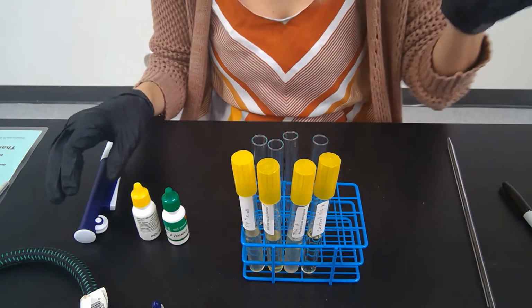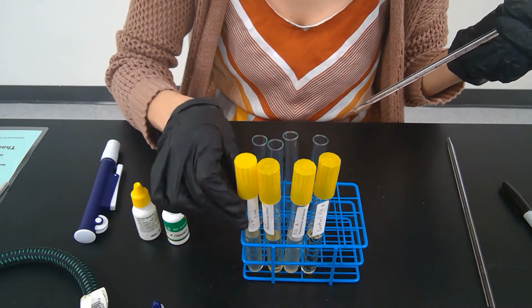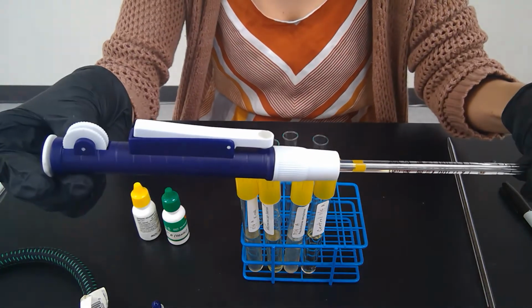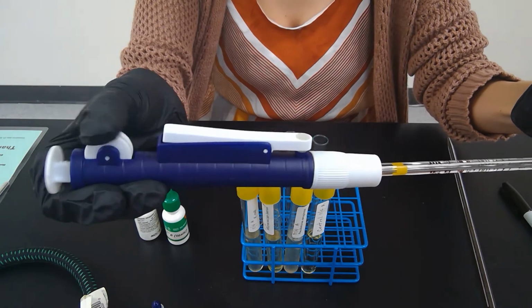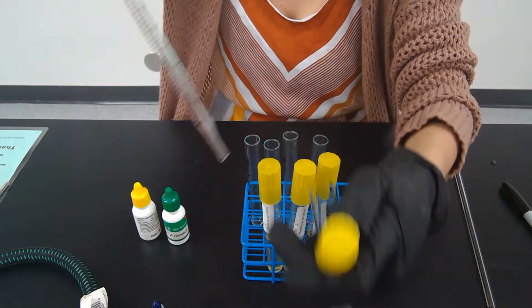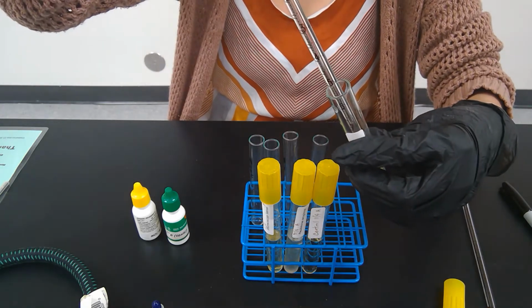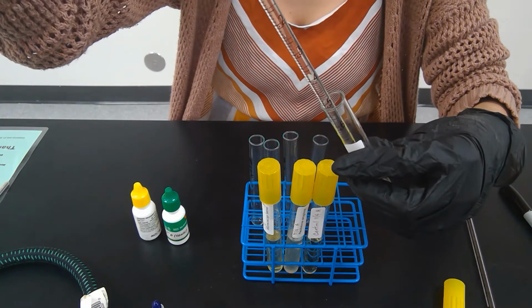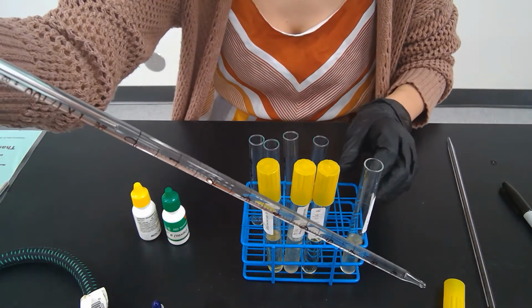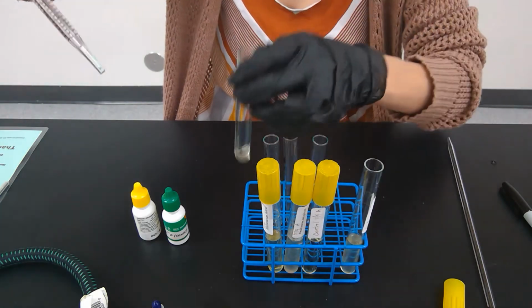You now will take this pipette, and you're going to take some of this liquid, about 2 ml of this culture grown, and put it in a separate tube. So you grab this pipette man here, and you can move this back up and down, and that will pull the culture out of here. You don't have to be sterile for this, because these cultures will be thrown away after today. So this entire pipette here will hold 2 ml of liquid. And so I'm going to dispense that 2 ml of liquid into this new tube here.